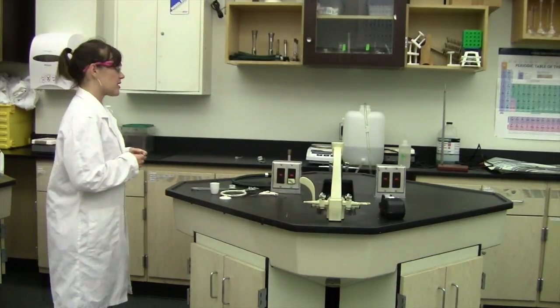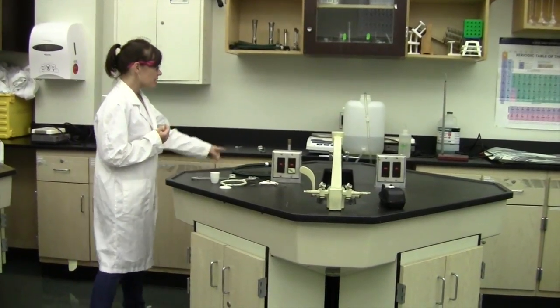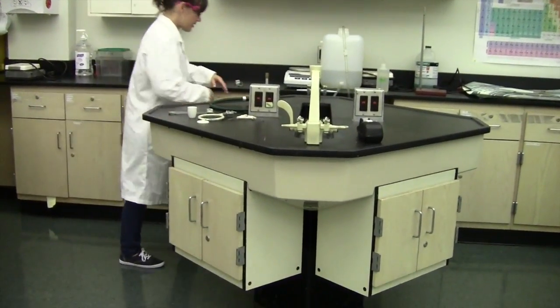So we need a few items. The first item we're going to get is a ring stand and these are all found in the little cubby area behind this lab bench.